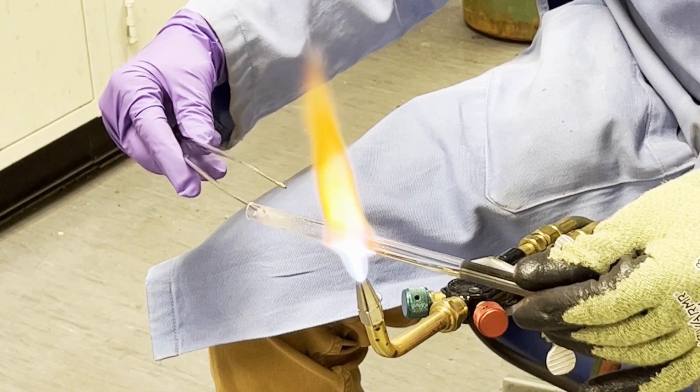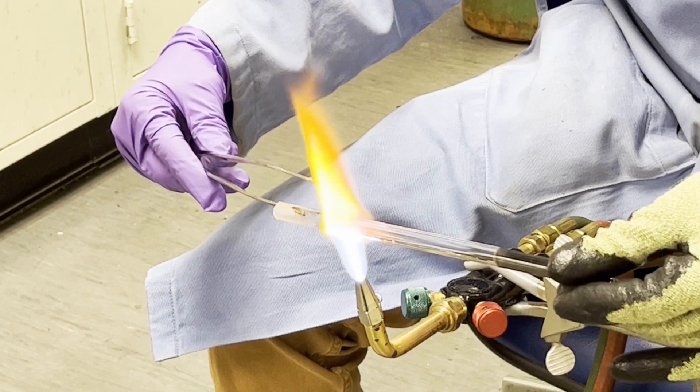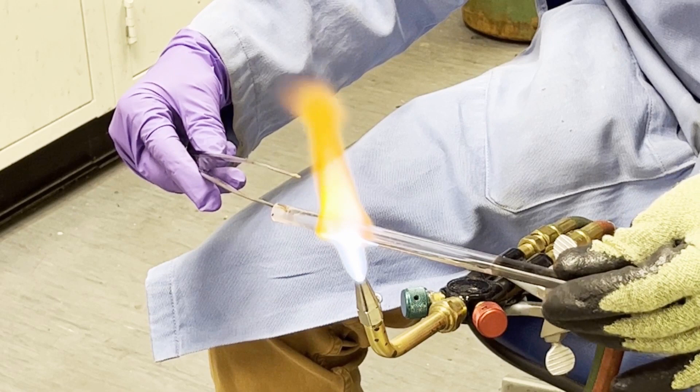Really you're just going to do this—you're going to heat the things until you see them sort of glow and fall off your tube, and that tells you that it is nice and clean so that we can have nice pristine tubes.